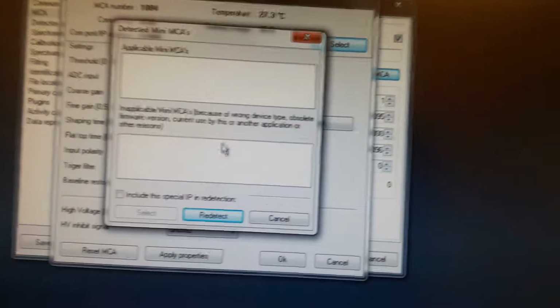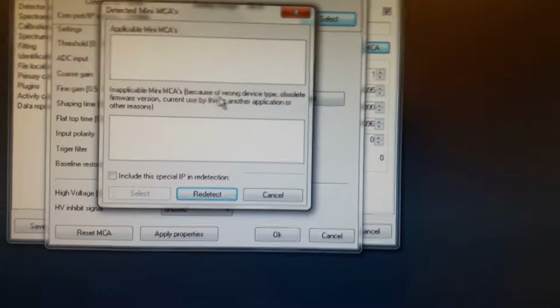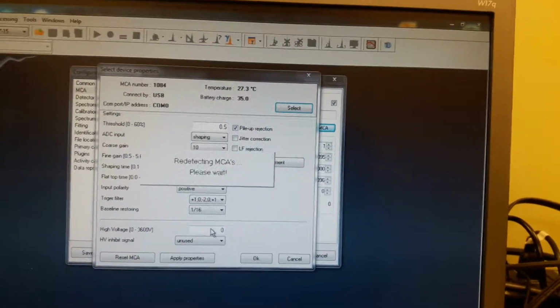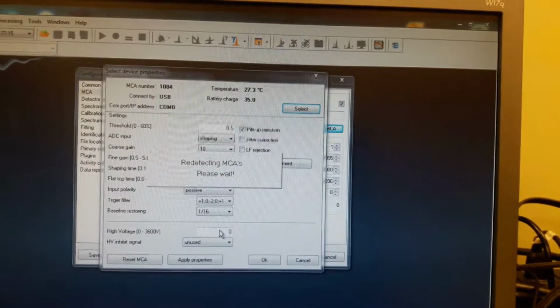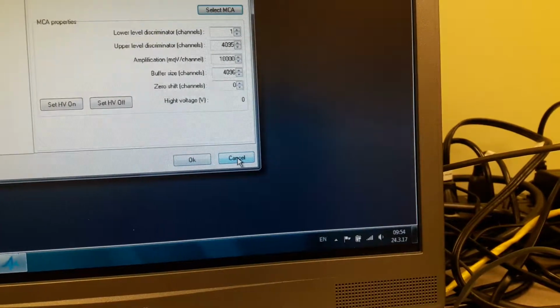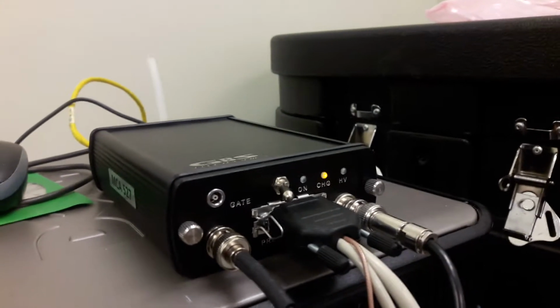And you can see from the window in here that there is an applicable MCA and an inapplicable MCA, which means there is no detection whatsoever for this MCA device which is connected with our system. And even if we press redetect, you will not be able to identify it. But we will show you how to solve this problem, hopefully. What we have to do is cancel out of the software and ensure that the MCA is in the off position before we initiate the connection.